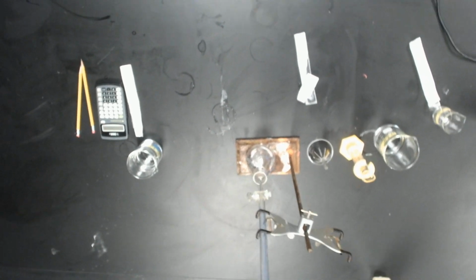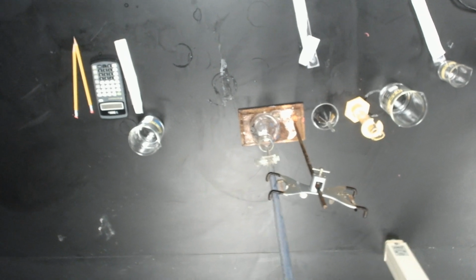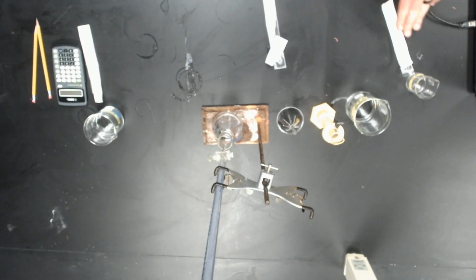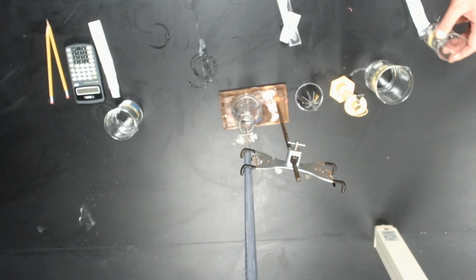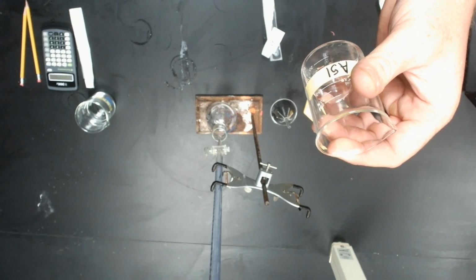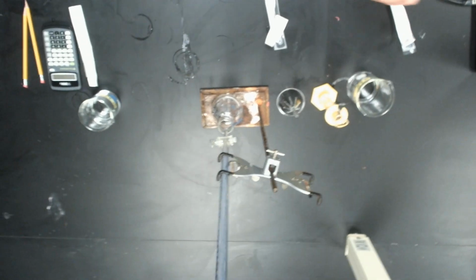Hey y'all, so we're getting ready to look at our pH lab for the summative, the one-on-one summative. Just want to go over what you will see at your station. So we will have an acid. This acid will not be marked acid. We'll be having some kind of weird name on it. That's going to be our unknown sample ID.